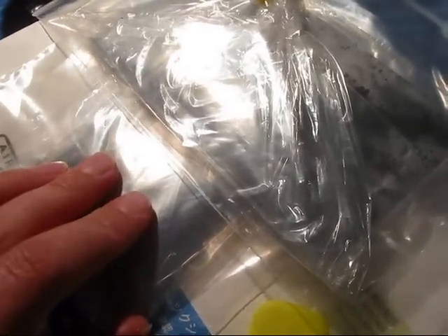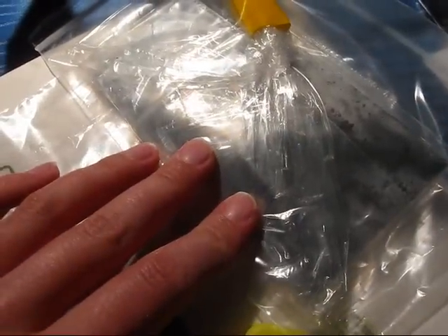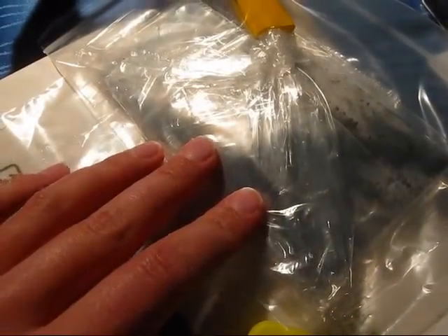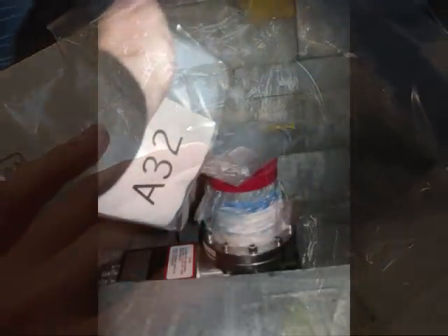I'd say there's definitely something in this soil which has been taken near Tokyo. It's not from Fukushima, it's from Tokyo. And we're gonna put that into a high purity germanium detector to get a nice gamma spectrum and see what's going on with this stuff.